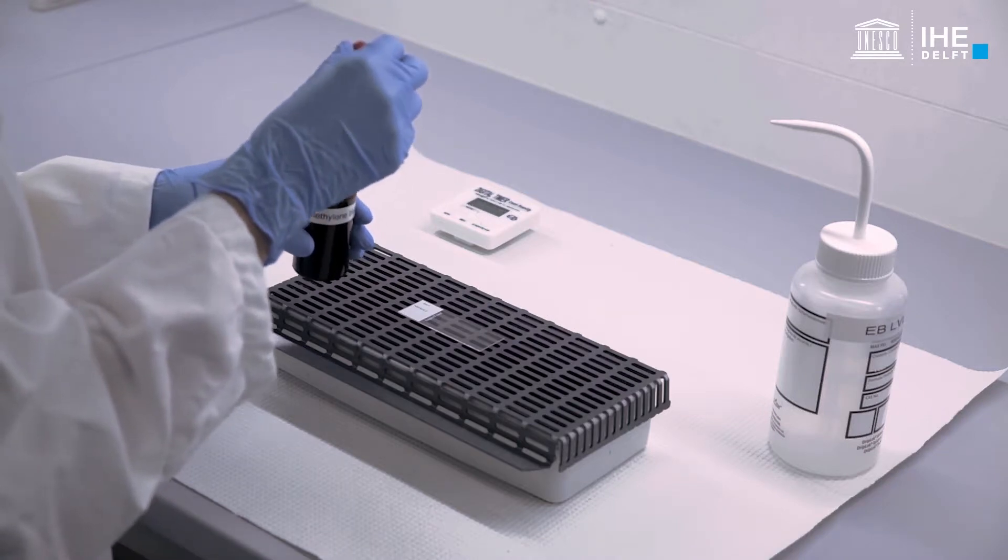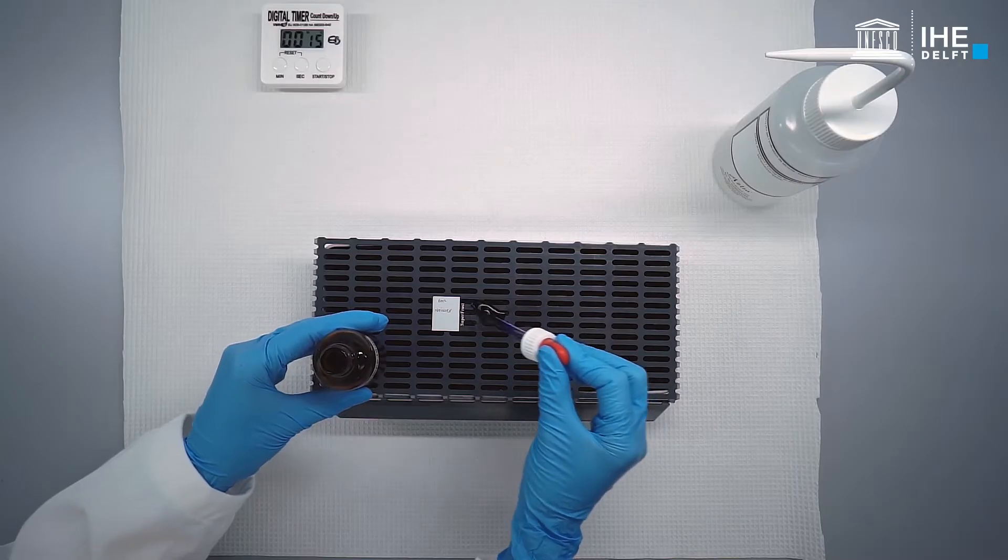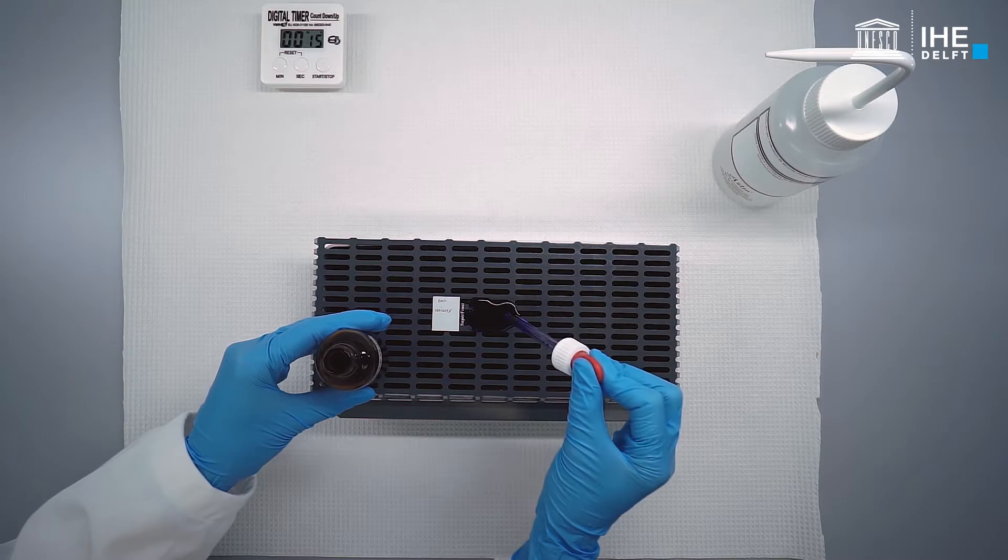Flood the sample with freshly prepared methylene blue working solution and leave to stand for 15 seconds.